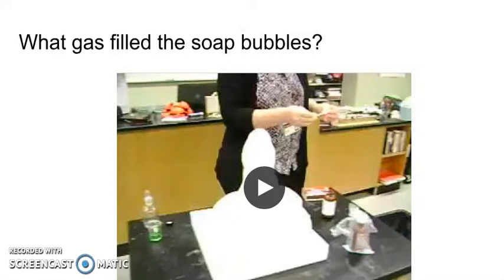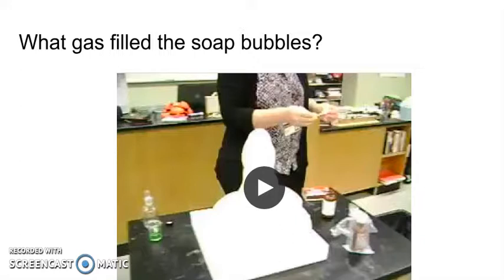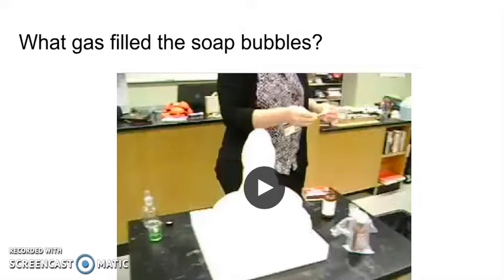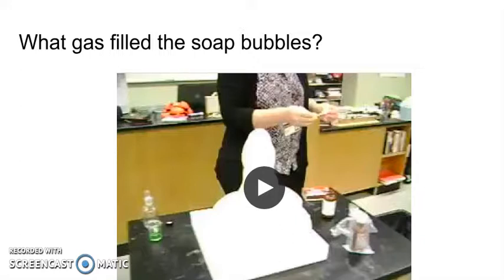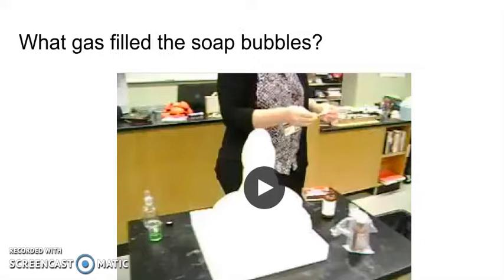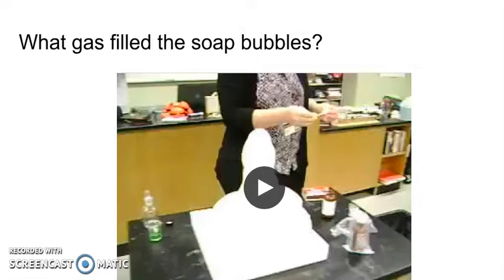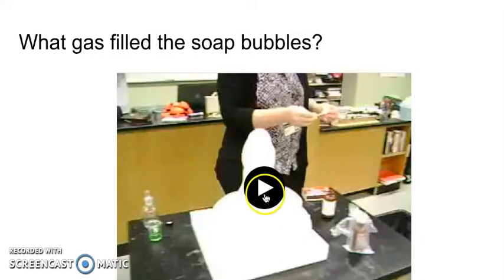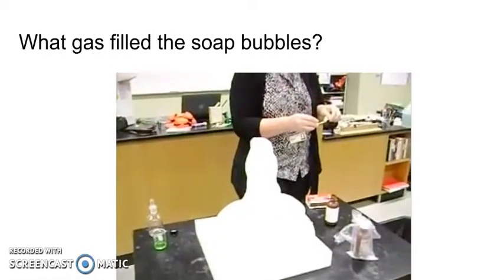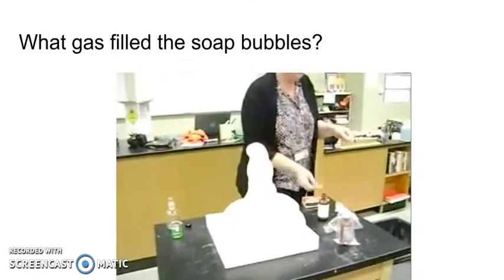The excess energy is released into the environment. Now we'd like to look at what gas is in the bubbles — would it be hydrogen gas or oxygen gas? What we're going to do is light a splint and let the glowing splint go into the bubbles. If it were hydrogen, it would cause a little bit of an explosion. If it were oxygen, it just supports the combustion of the stick and the stick would glow even brighter. So let's take a look — this is oxygen and not hydrogen, it's a burn.